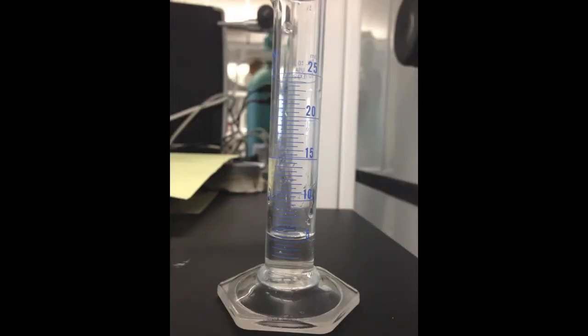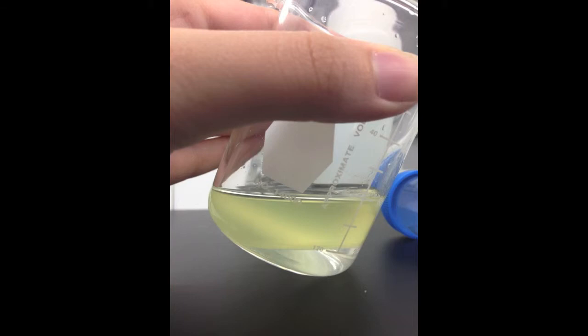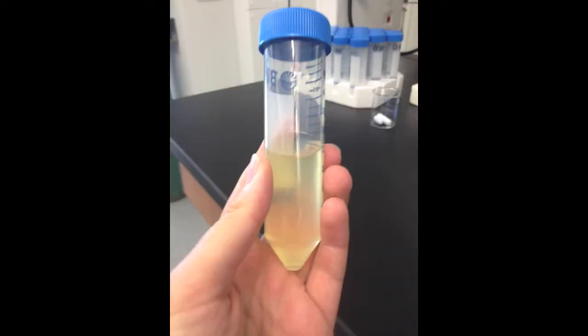Repeat this process with 5 milliliters of distilled water. Add the water to the biodiesel fraction and gently swirl. Collect and discard the bottom layer using a pipette. If necessary, this is a good place to stop. Store your biodiesel in a centrifuge tube or an Erlenmeyer flask with a stopper. Record any observations after allowing the biodiesel to sit.